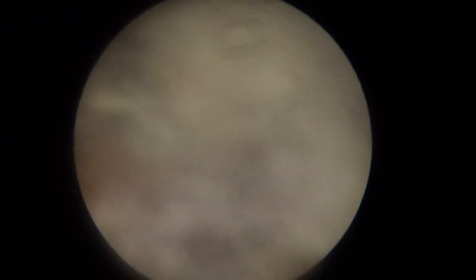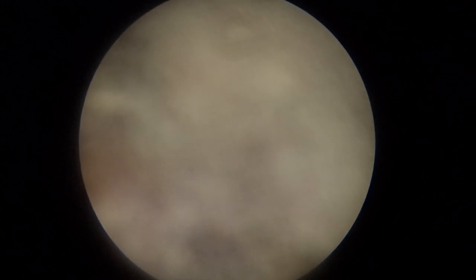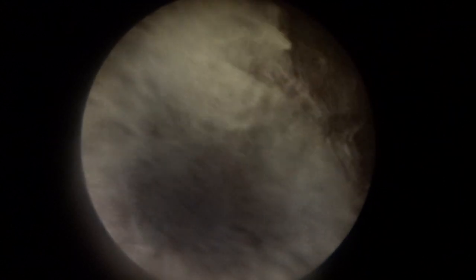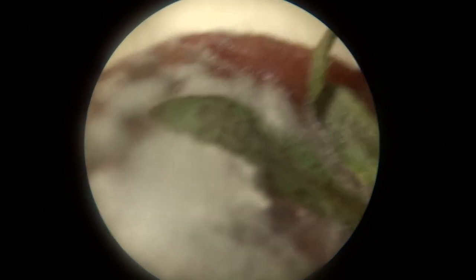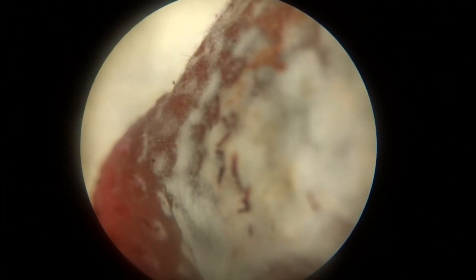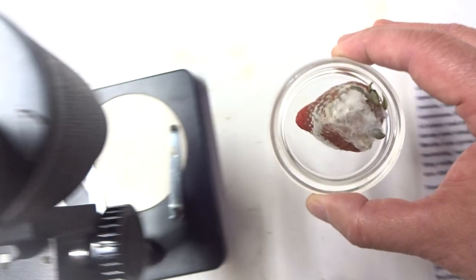Let's look at this under high power. Notice under high power that it seems fuzzy — that's because the mycelium is so thin and small. Let's look at it again under low power. Now we can see more of the mold. We'll move it around a little bit. You can see the strawberry as the substrate. And that was the strawberry.